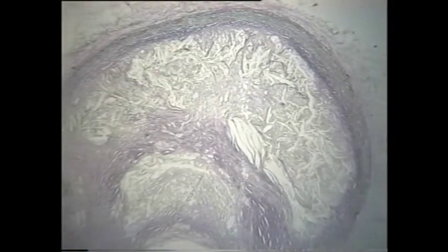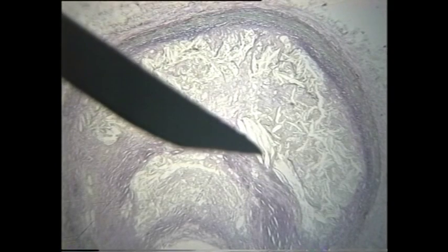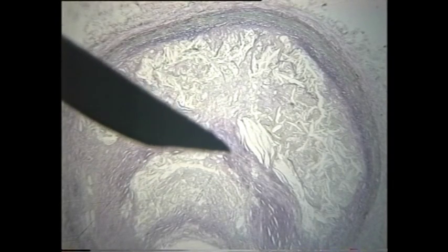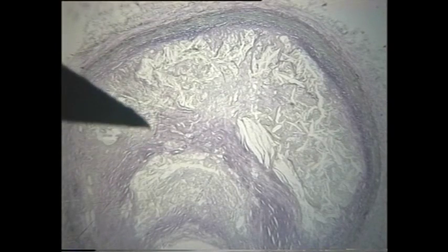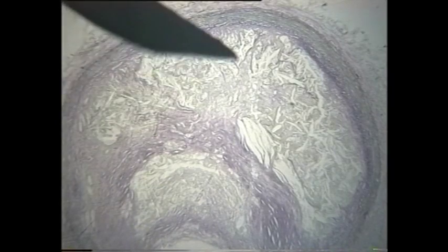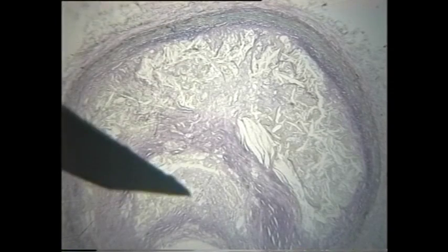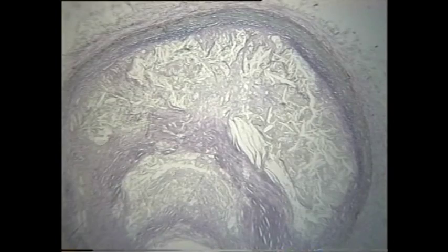Now this atheroma is made up of different things. It's largely cholesterol - here for example there are some crystals of cholesterol, crystalline cholesterol. Here the purple stain is collagen, which is from fibrous tissue. But the main thing is that the whole lumen, or what should be lumen here, is completely filled up with atheroma. This artery shows very advanced, very severe atherosclerosis.